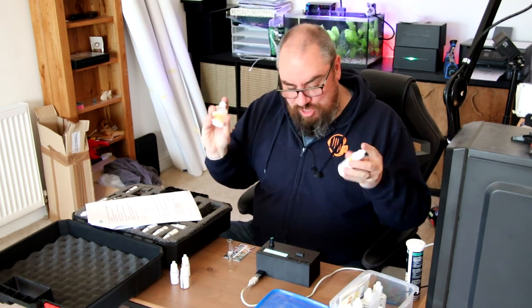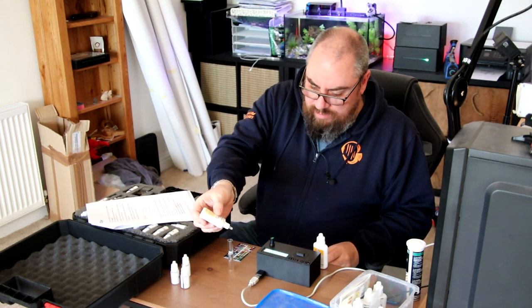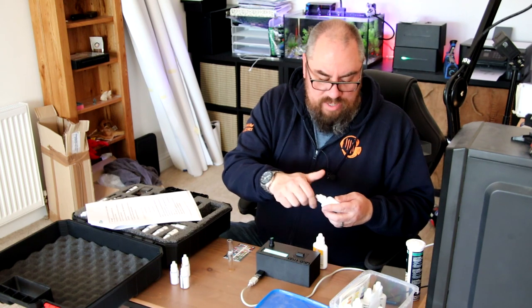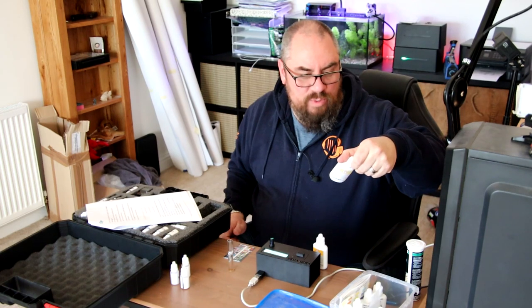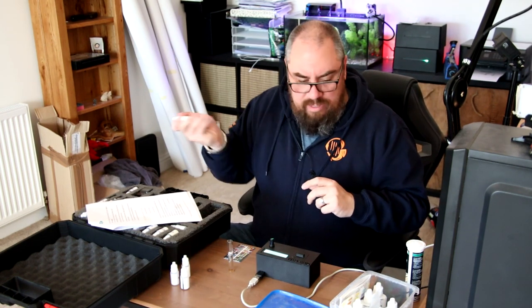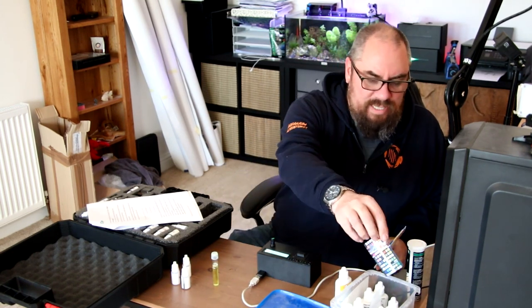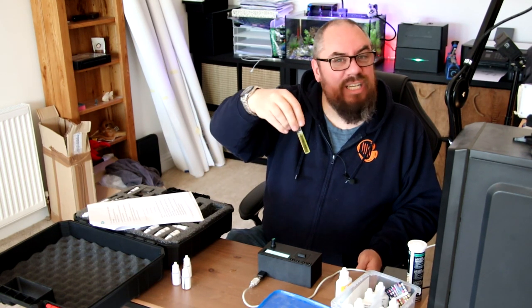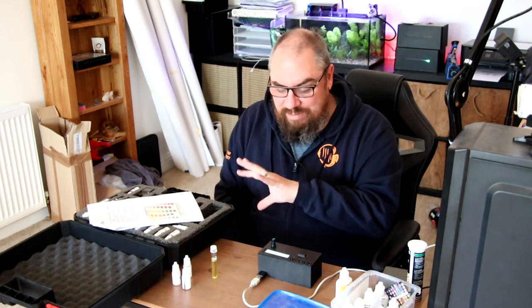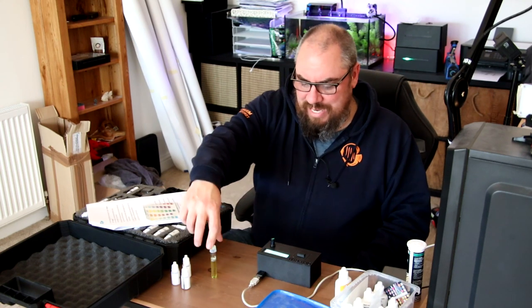The key with the API test seems to be just shaking things vigorously. You add eight drops from bottle one — one, two, three, four, five, six, seven, eight. It's important to remember these things have a shelf life, so check the best before date on the bottle. This one's July 2024, so well within date. Then eight drops of the second bottle. We've still got 11 and a half minutes to go on the Diode Probe test.